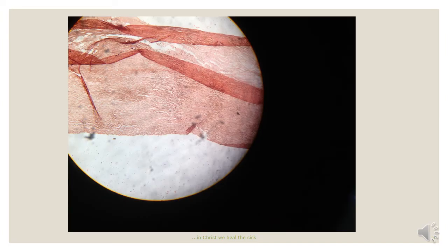This is also a slide of the elastic artery. Here the slide was stained with H&E, and the folds we are seeing are just due to the process of tissue preparation and have nothing to do with the main structure of the slide itself. We can identify the lumen of this elastic artery, and then map out the narrow tunica intima, and the rest of what we are seeing here is the tunica media.